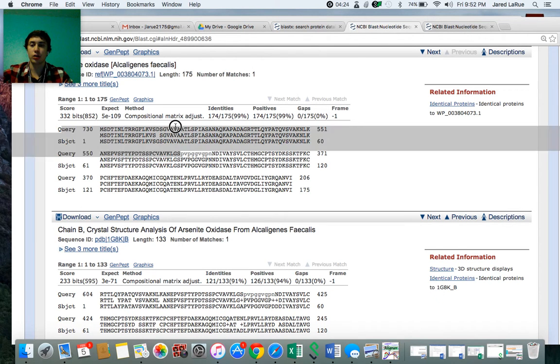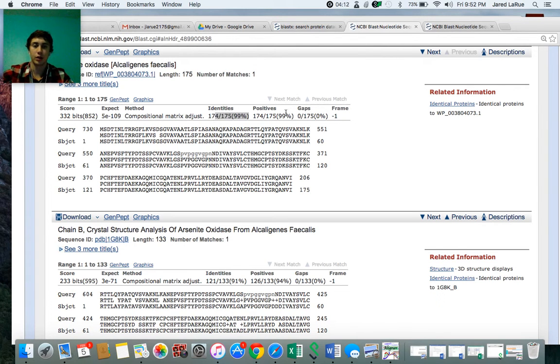Once again, we are the query, they are the subject every time. Our sequence is the query. So it looks like we have a D here. Looks like there's one issue, one identity error. If you look here, positives 174 to 175. So we matched all of the amino acids except for one. Looks like it's right here. We have a D where it should be a G.